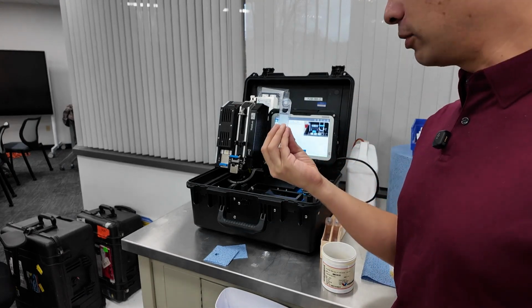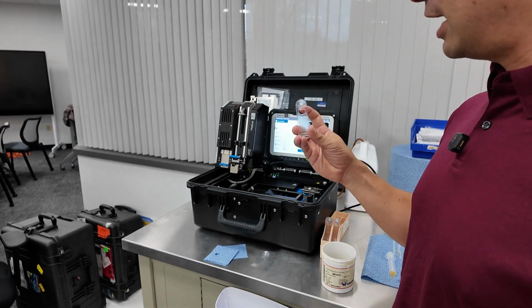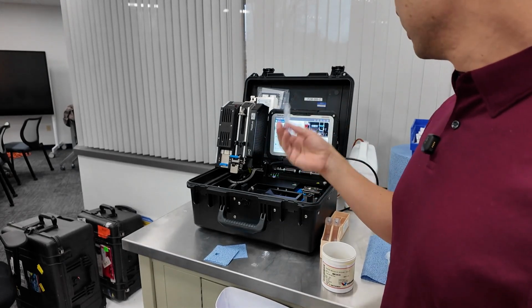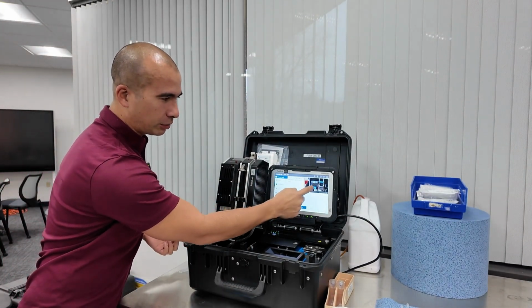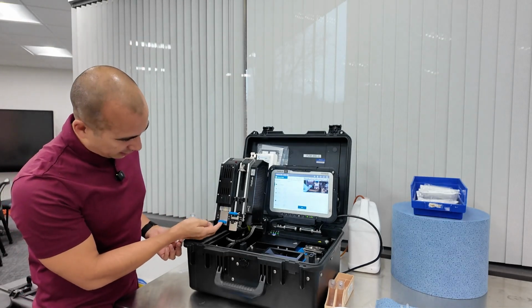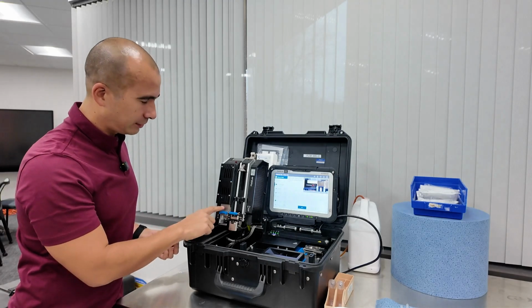The filtergram is effectively like patch analysis, but it is calibrated to a certain size of patch just so that we can get a couple of measurements out of it. Fortunately, this machine will do instructions. You can press play and it's going to give you some instructions on how to do it. So here, I open this, place this in. I close this, right?